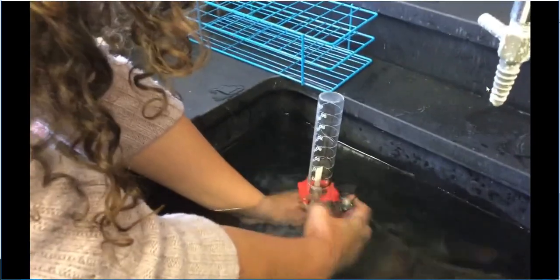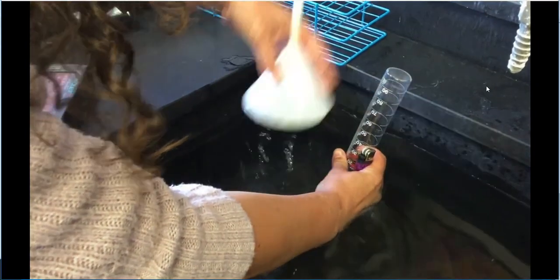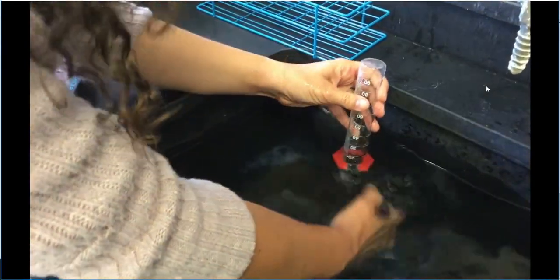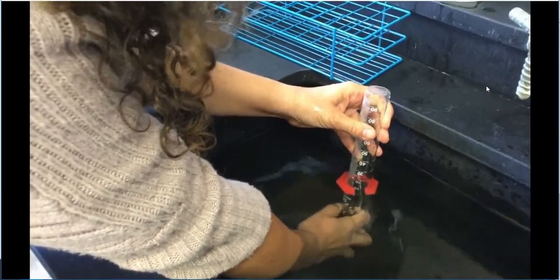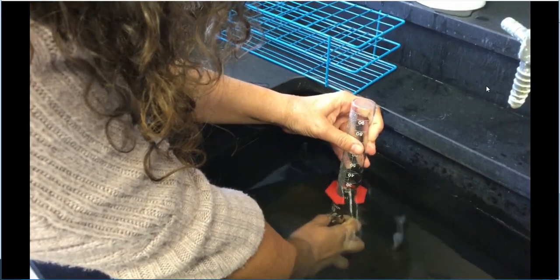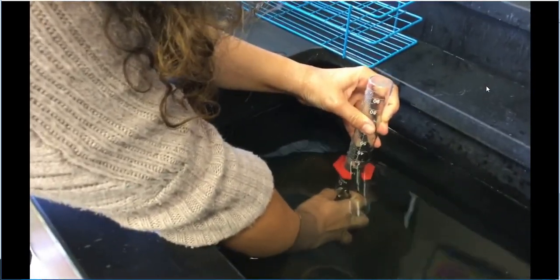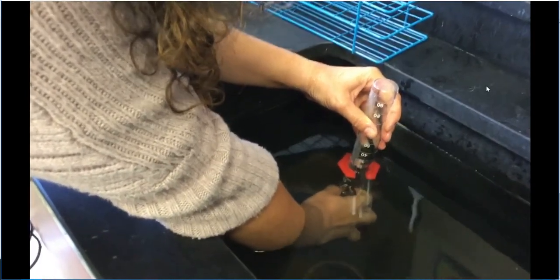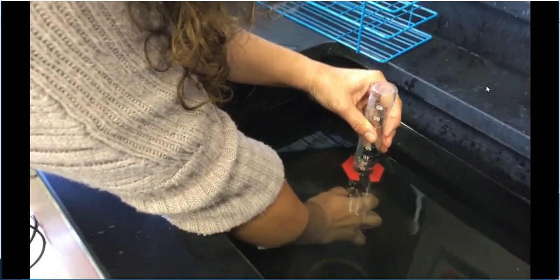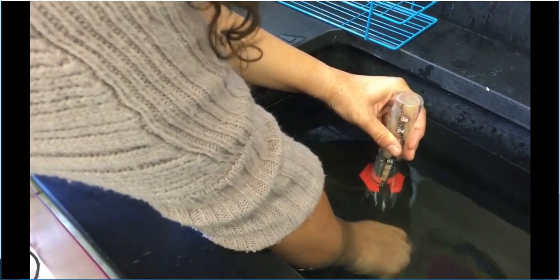Okay. All right, I'm going to carefully do this. I hope I don't mess this up. Hold on. We're going to take the funnel out just so I have a little more room. Watch that water level drop. So hopefully you guys can kind of see that in the video. I know it's really hard. We're going to go all the way until it hits the top of the red thing, which is at the 10 milliliter mark, which means we would have 90 milliliters of gas. Okay. All right. So I'm going to go ahead and remove our little butane lighter.